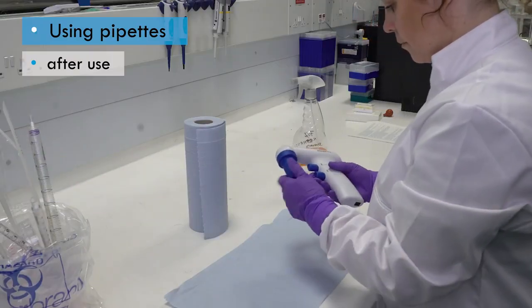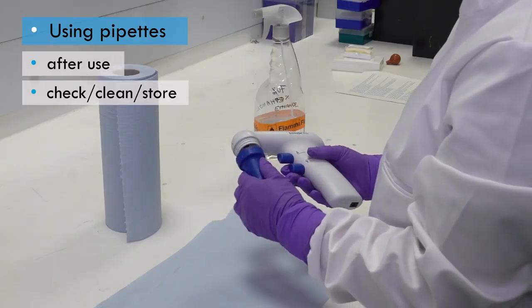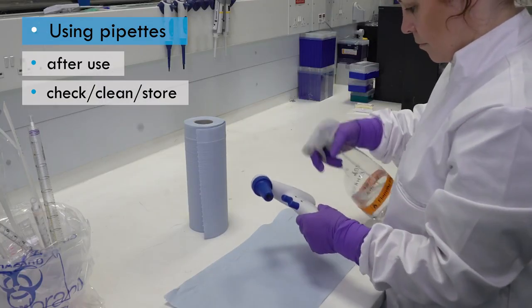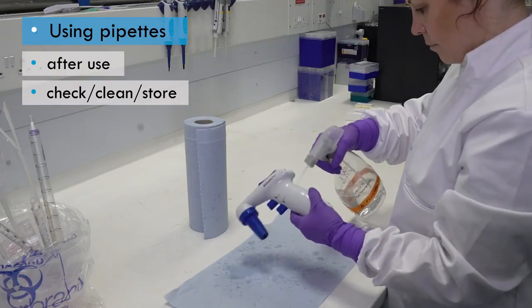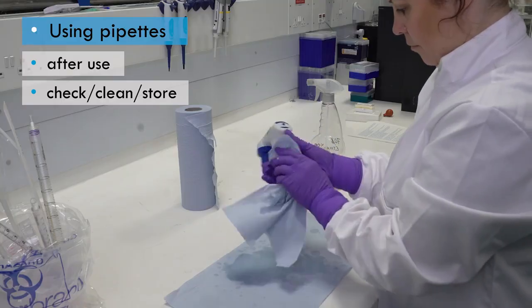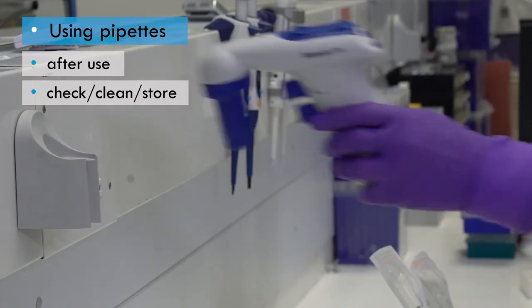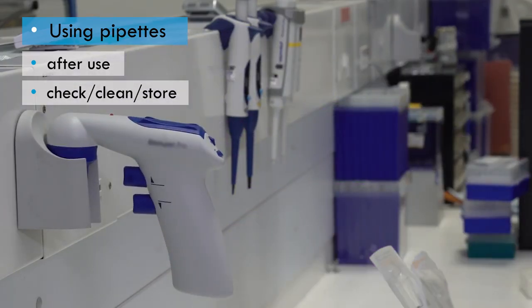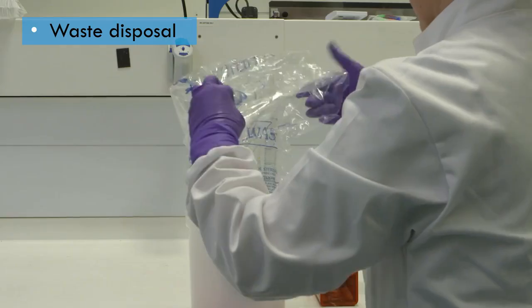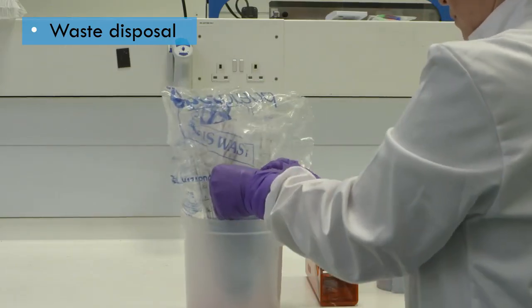When the procedure is complete, check the filter and replace it if necessary. Wipe down the pipette with an appropriate disinfectant before putting it back in its storage place. Seal up and dispose of your pipette tip discard container through an agreed waste disposal procedure.